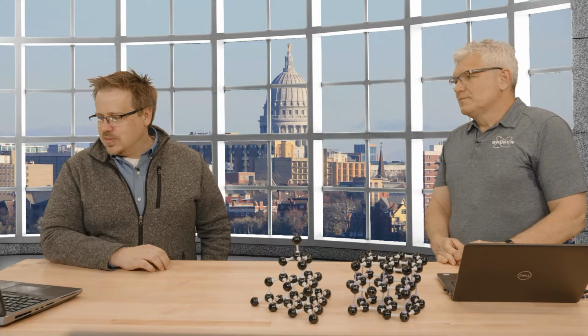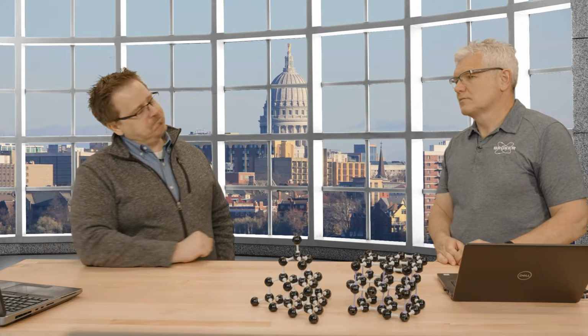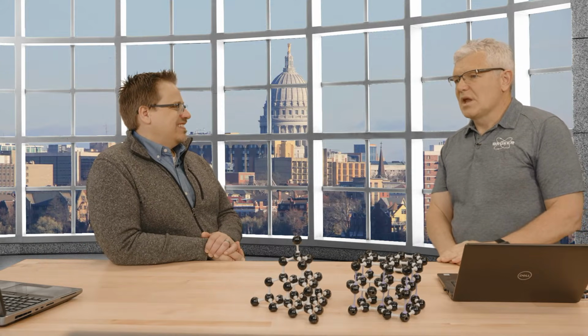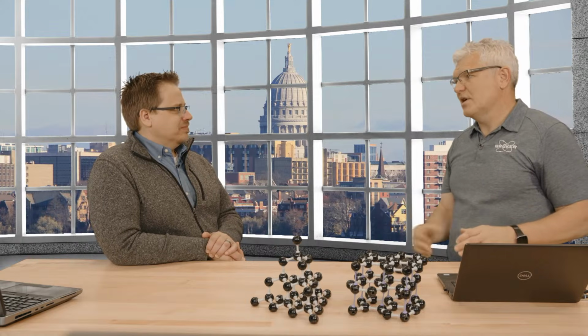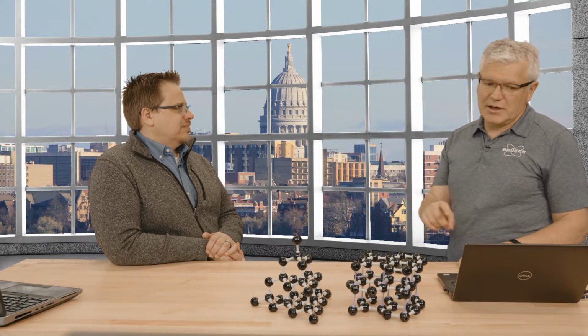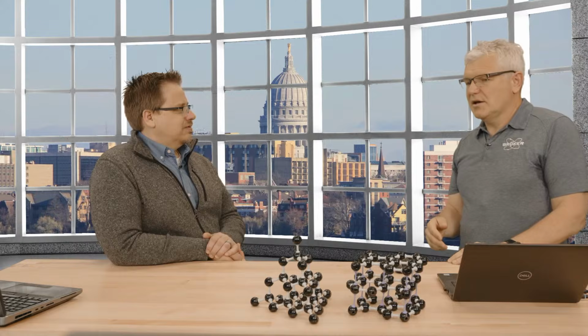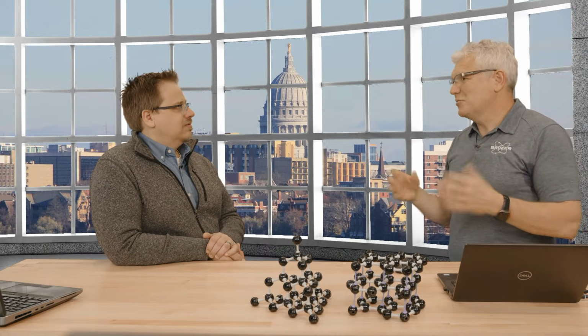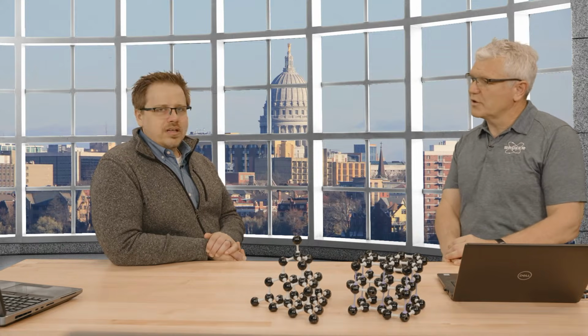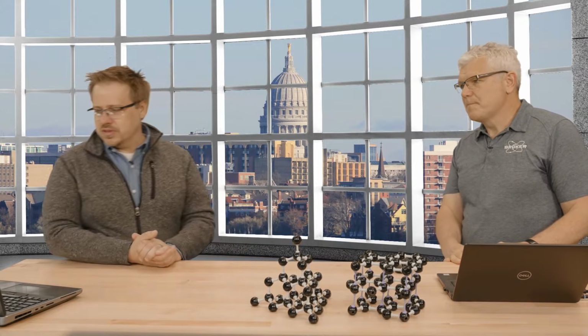All right. From Eric, are specific tools better for different types of twinning? Use them all if you can. I'm a very visual person, so for me, finding these patterns, seeing these patterns, and I've done it for quite some time, is very easy. And it's also because I demonstrate software a lot. If you click on a black box system and it just pops out, there's not much to talk about unless you want to get deep into the algorithms. And I like RLAT because it's hands-on. You can actually do something, virtually do something with the data. Use all the tools you have, and use whatever you feel most comfortable with. And getting experience with it, that's part of being a good crystallographer.